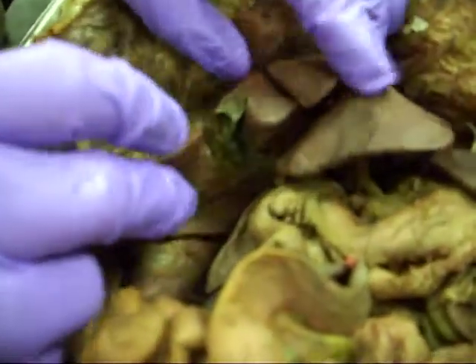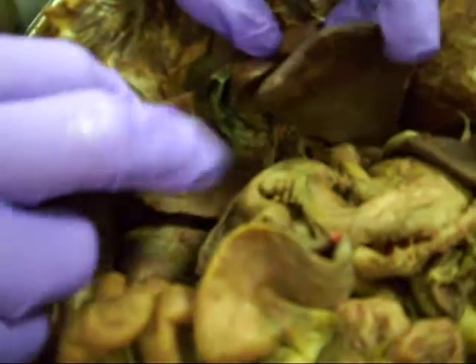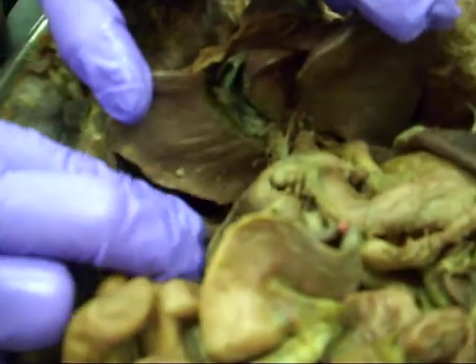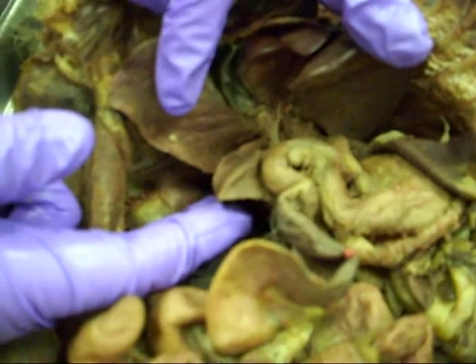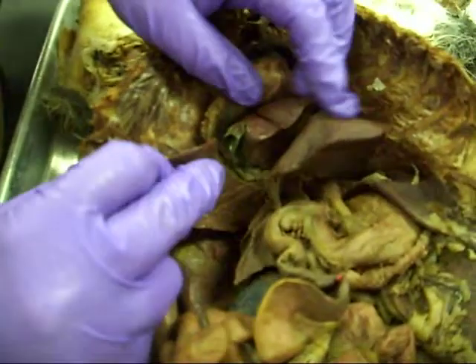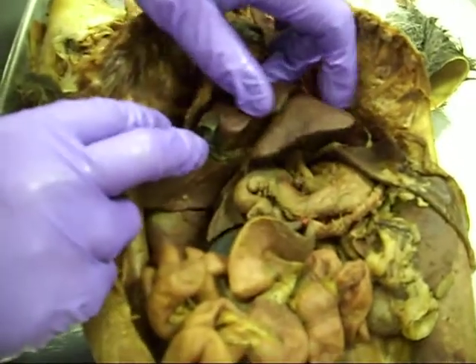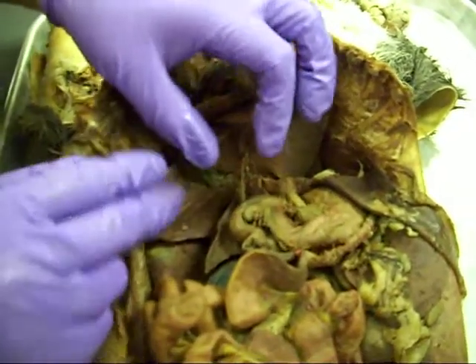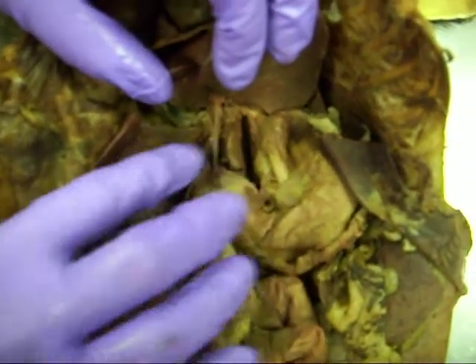Here is the diaphragm. Once you get below the diaphragm, now you're in the abdominal cavity and you're looking at the liver. This right there is the gallbladder. The lateral lobes on the right side are actually kind of small and they're behind here — there's an anterior and a posterior. Check your book on that. So there's an anterior and posterior lateral right liver, then you have the medial lobe of the right liver. Over here you have the lateral part of the liver on the left side, and you have the medial part of the liver. This cat has an unusually small caudate lobe of the liver — we'll look at another one so you can see it better.